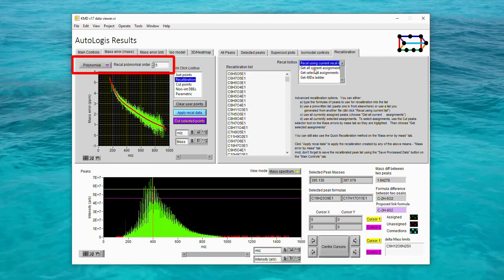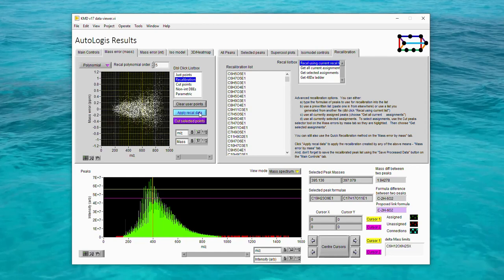You can tell from these two controls that currently AutoLogis is fitting a fifth order polynomial to the recalibration data. Having processed a lot of this sort of data with AutoLogis, I found that a fifth order polynomial usually works well, and that's always where I start. But you can easily change the order of the polynomial simply by changing the number in the box. Now to recalibrate the data using that curve, we click the Apply Recal Data button. This is the style of recalibration that I use most often when I'm processing data myself.